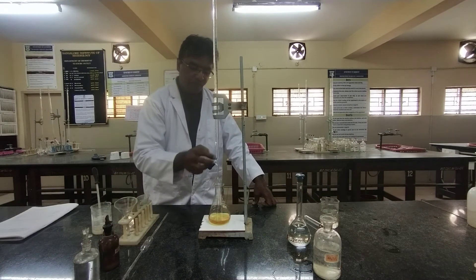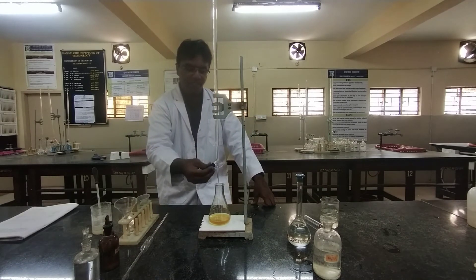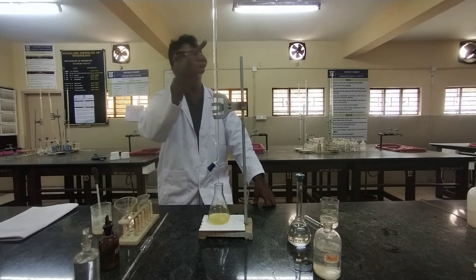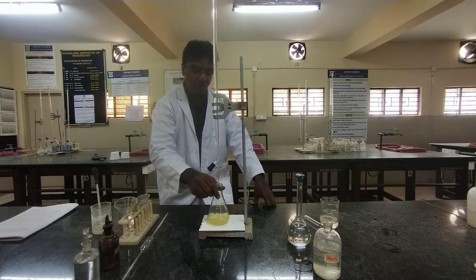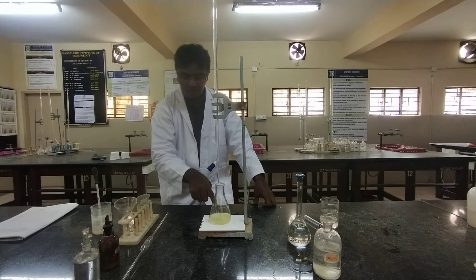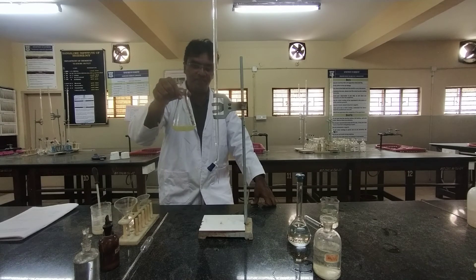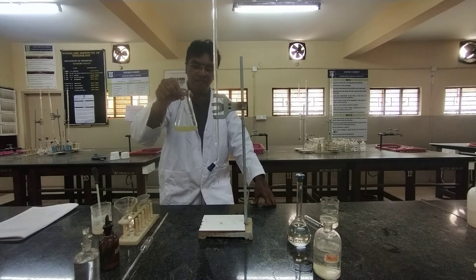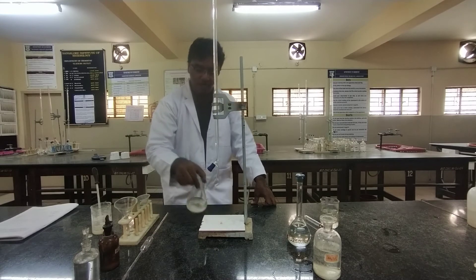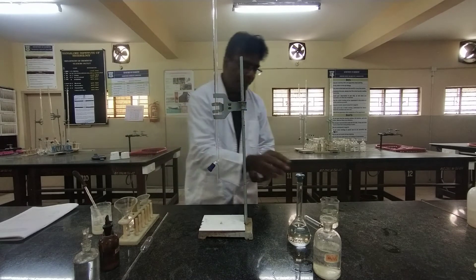Titrate this liberated iodine against sodium thiosulphate taken in the burette. Sodium thiosulphate reduces iodine to sodium iodide and is itself oxidized to sodium tetrathionate. As you keep adding sodium thiosulphate, more and more iodine is reduced, the concentration of iodine decreases, and you can see the yellow color becoming progressively lighter — from dark yellow to lighter yellow to very light yellow. When the color becomes pale yellow, you add 8 to 10 drops of starch indicator.